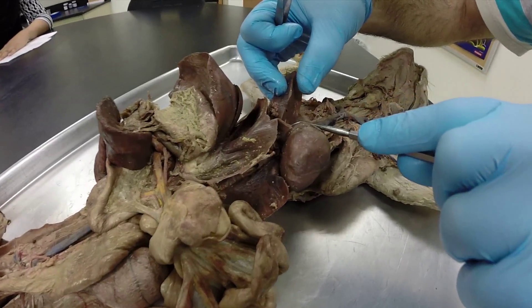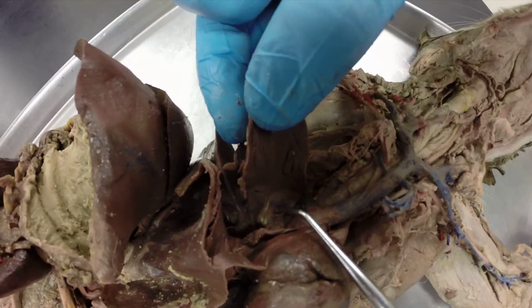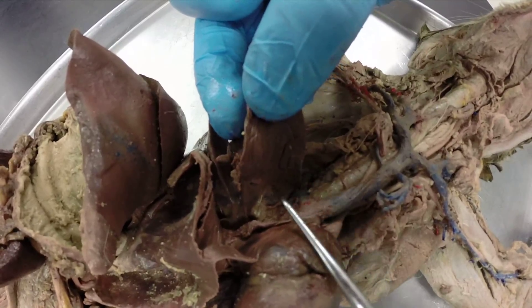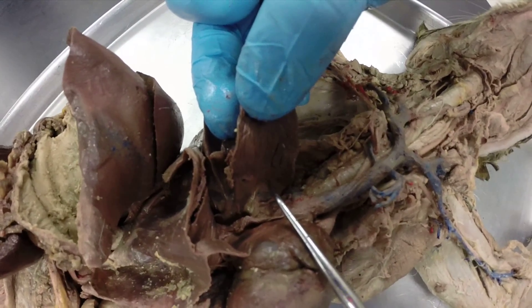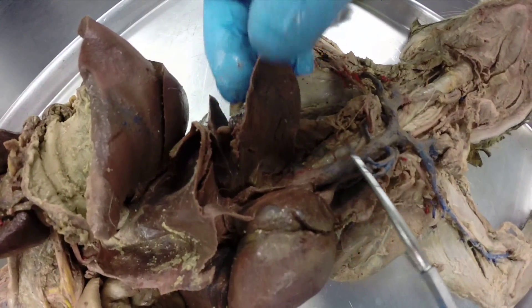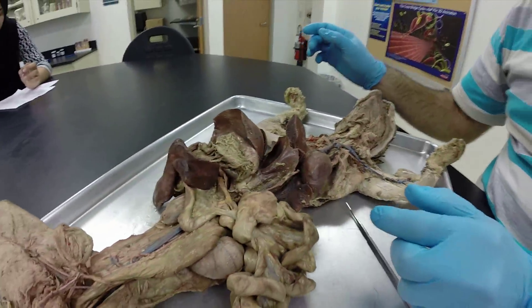We also have the pulmonary arteries and veins. If you see something associated with the lung that's red, that's a pulmonary vein. If it's blue, that's a pulmonary artery.